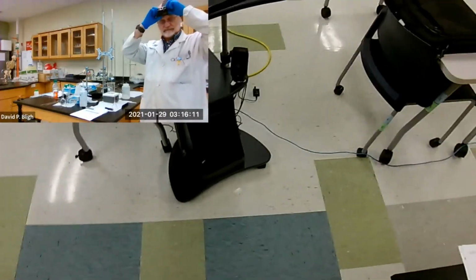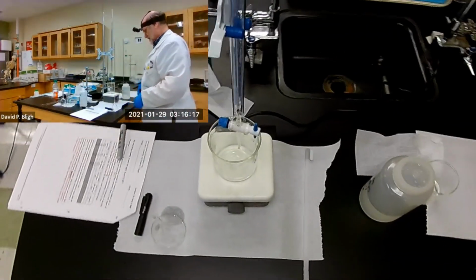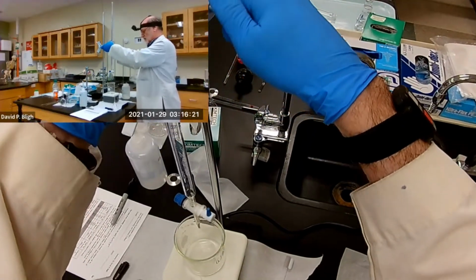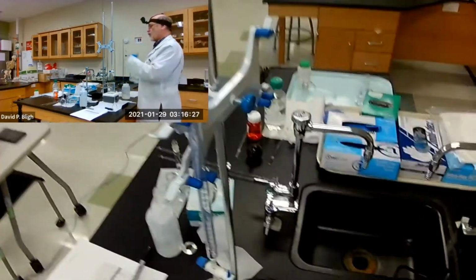Now I need to do another sound synchronization. So you get to watch me clap my hands. I can see it from both of them. All right. So there we are. And off the tip. Now we want to fill it up.